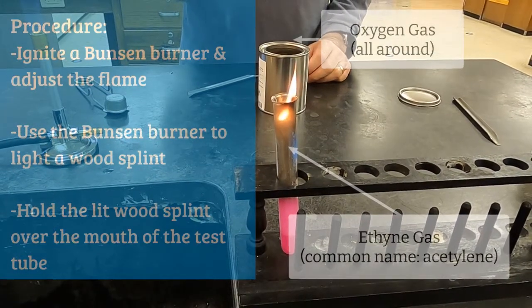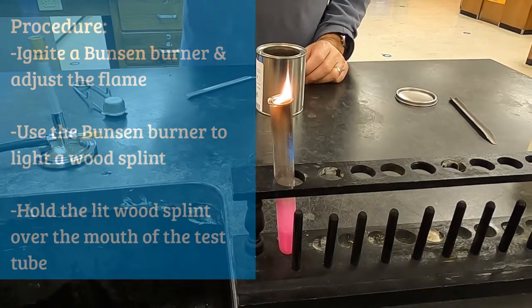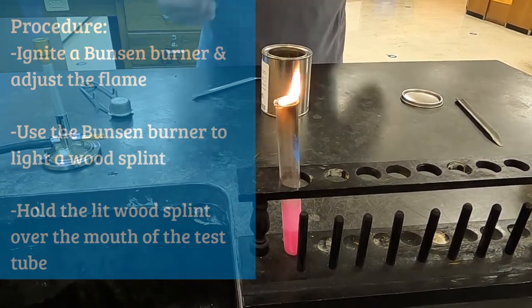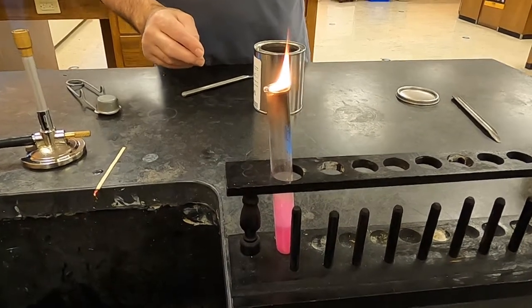Here we are igniting the gas that is being produced, the ethyne gas, and notice that the flame is only staying at the top because even though the acetylene gas, the ethyne gas, is flammable, it does need oxygen to react.